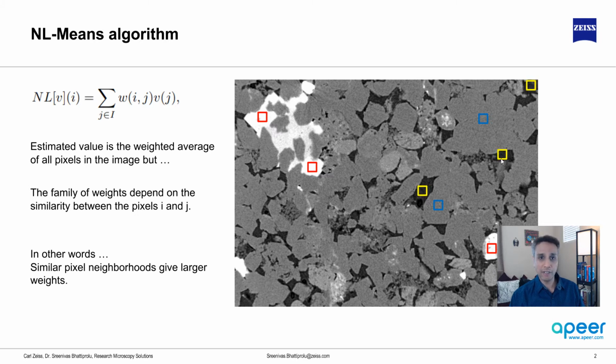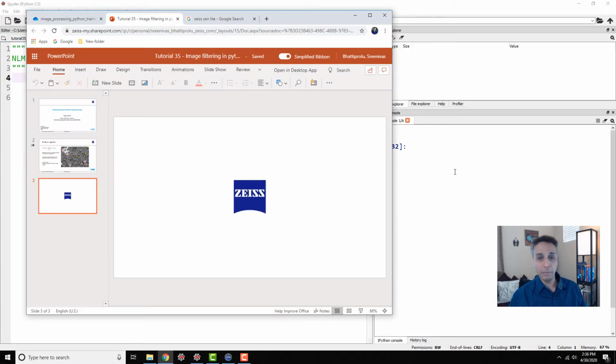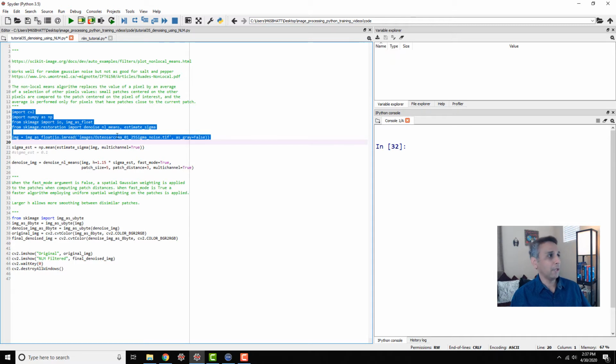And again, I added another example here. Now let's see how it works in Python. Again, please go ahead and Google search for non-local means filter and find the original paper to get much more in-depth knowledge about this filter. The intention here is to make sure you know what it is and how to use it in Python, not to describe the entire paper for non-local means. And maybe in future, if we have time, we can do those discussions. So coming to our Spyder IDE, as usual, I have written a few lines of code. Let me copy these few lines of code at a time so we can talk about it, okay?